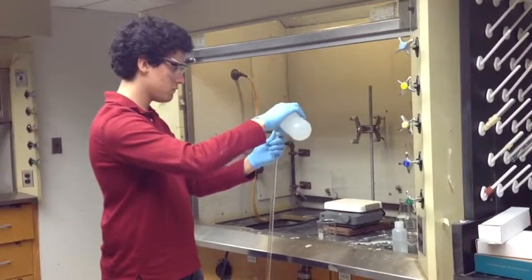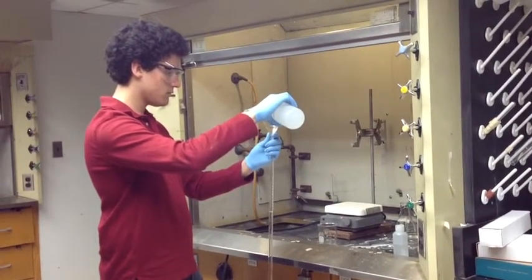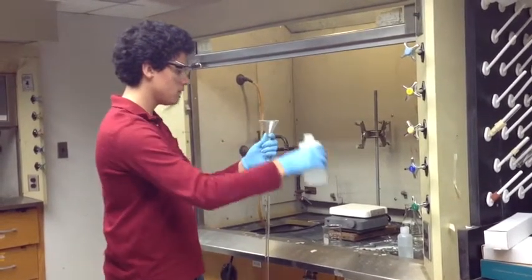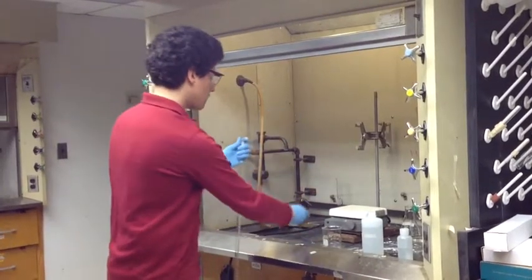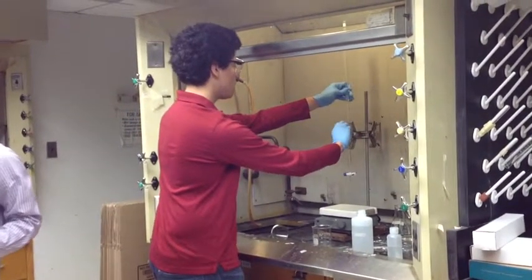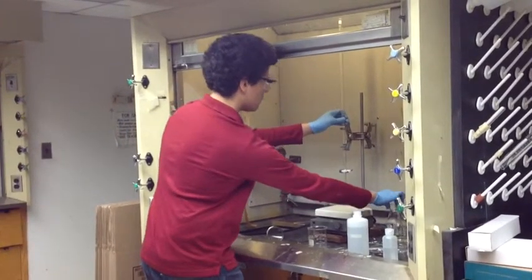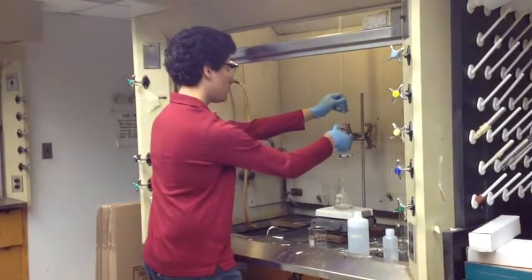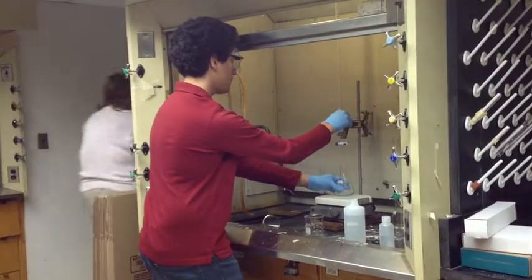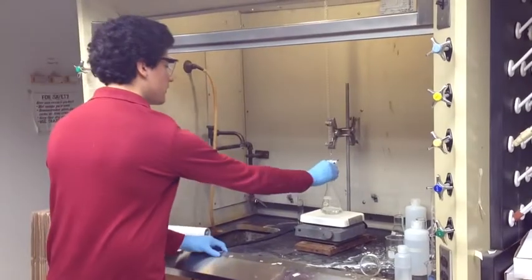Place the funnel in the top of the burette and fill the burette full of NaOH solution. Make sure that NaOH does not go above the 0 marking on the burette. Then place the burette into the butterfly clamp. Then place the Erlenmeyer flask with the KHP, distilled water and indicator underneath the burette on the stir plate. Place the stir bar into the Erlenmeyer flask and turn on the stir plate.